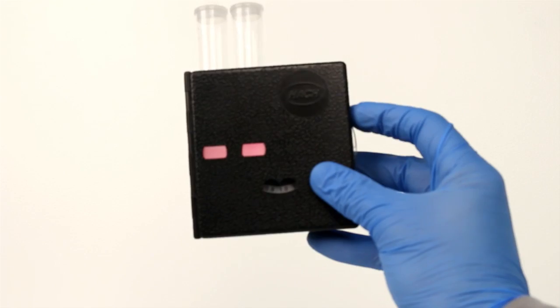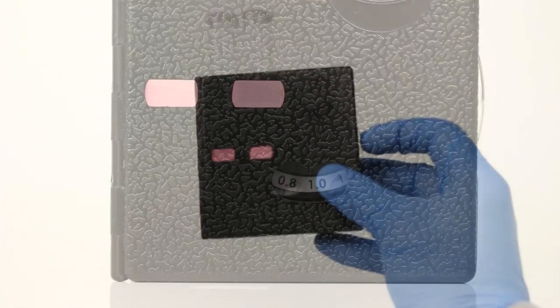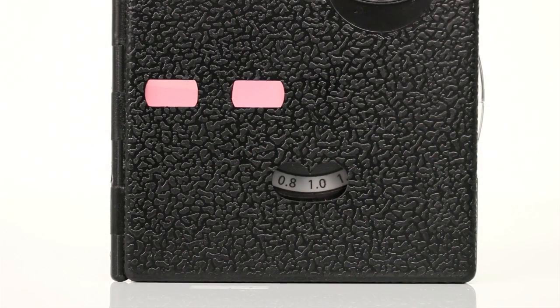Rotate the color disk until the color matches in the two openings. Within 1 minute, read the mg per liter free chlorine through the scale window.